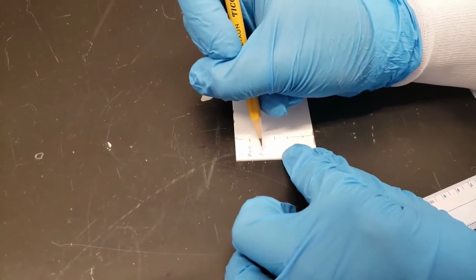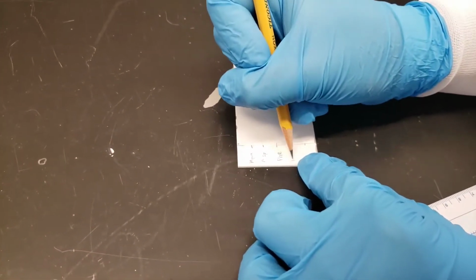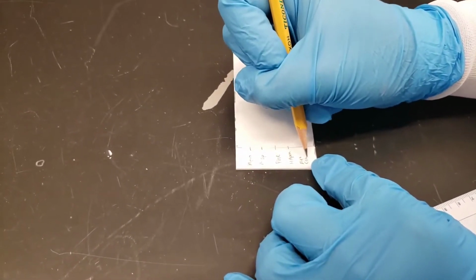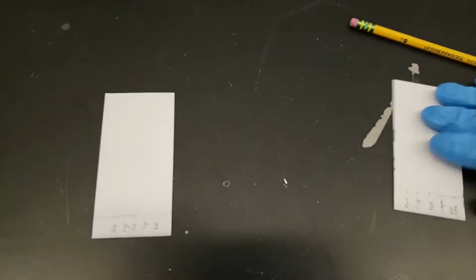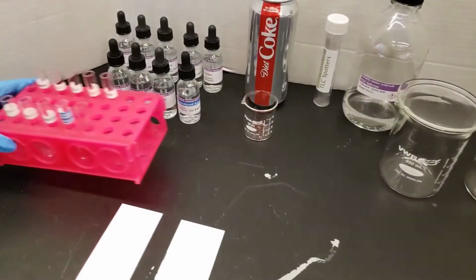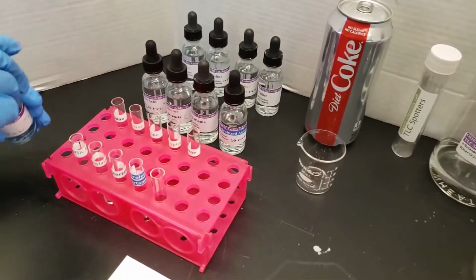In order to more easily dispense our amino acids, we're going to use a test tube rack, and we're going to just put a few drops from each of these bottles. As we drop the amino acid, just a few drops in each test tube, I have the structure of the amino acid in the lower corner of the screen.